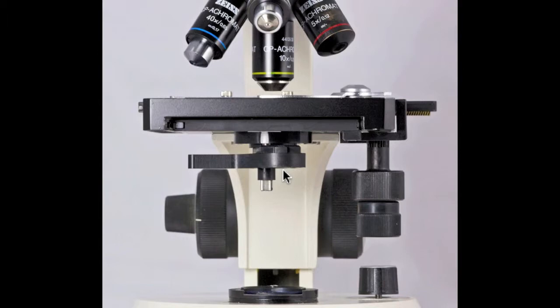Within the condenser, there is an adjustable aperture or diaphragm. This is used primarily to alter the depth of field. A smaller aperture produces greater depth of field, and a wider aperture will result in a shallow depth of field. You must learn to exploit this feature of optics to enhance your view of items of interest.